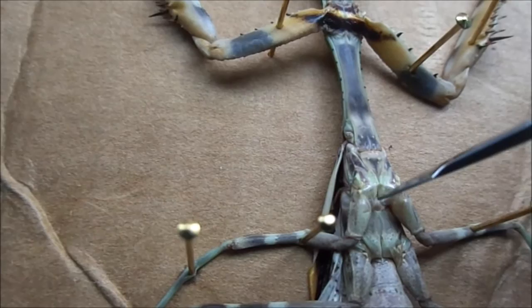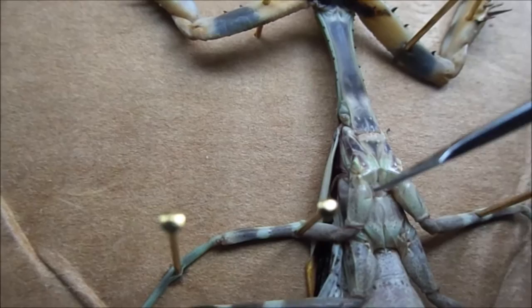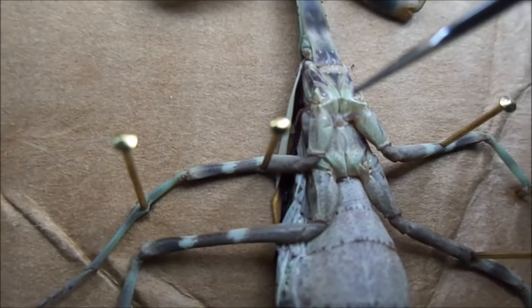Here — this little slit is the ear, the cyclopean ear. You have the cyclopean deep groove there and the cyclopean shallow groove there. Down here inside, there's the tympanum, which are extensions of the breathing system. Insects breathe through the tracheal system, which means they have little holes in the abdomen — little donut-shaped holes that open and close — leading to a big branching tunnel-like network all through the insect.